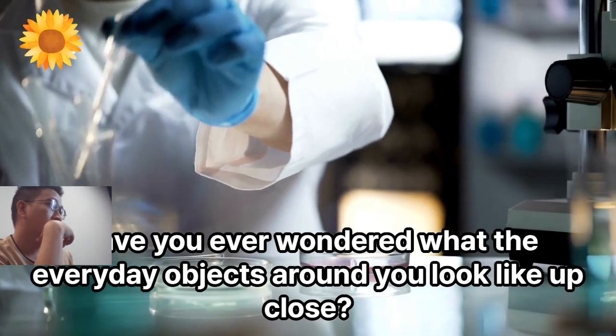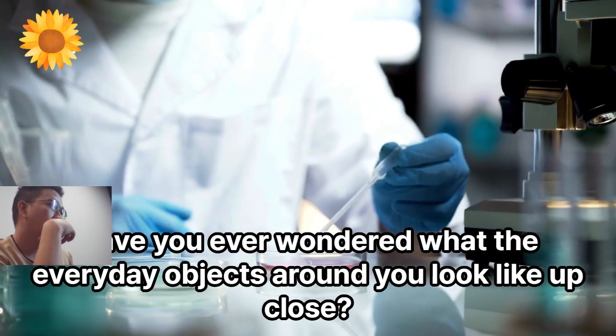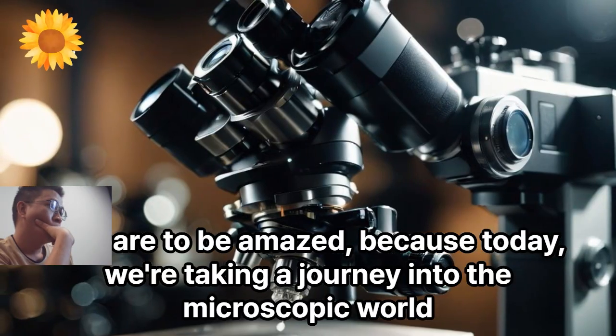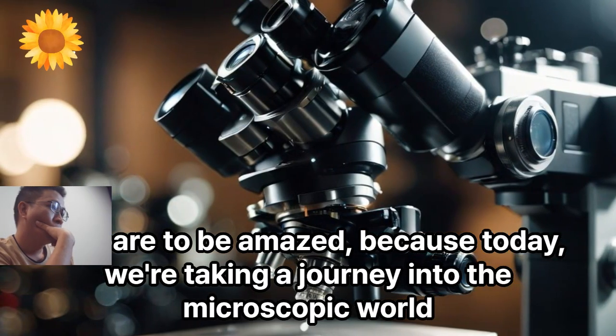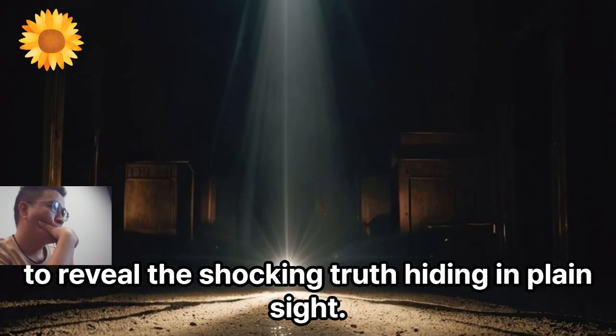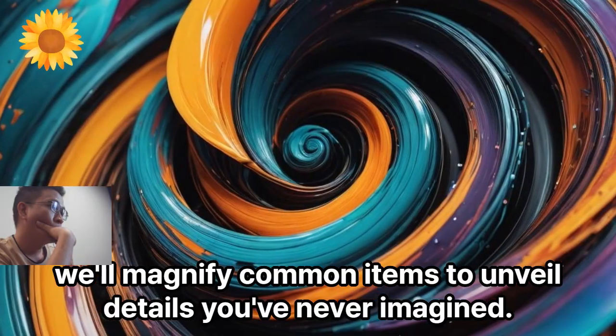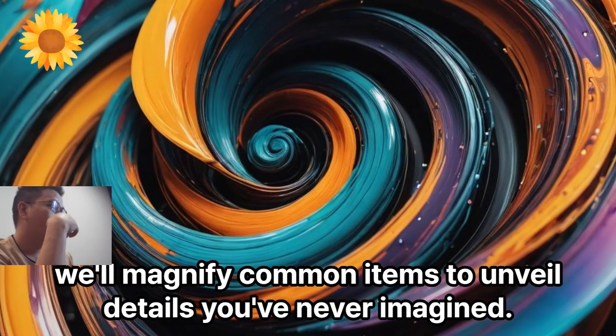Have you ever wondered what the everyday objects around you look like up close? Prepare to be amazed, because today, we're taking a journey into the microscopic world to reveal the shocking truth hiding in plain sight. Using the power of the microscope, we'll magnify common items to unveil details you've never imagined.